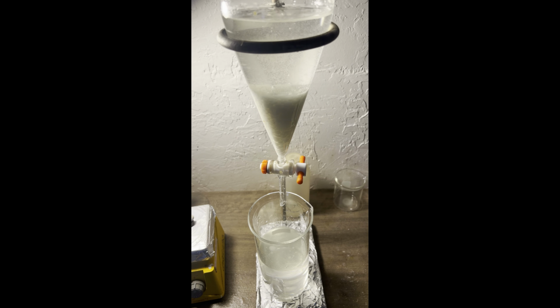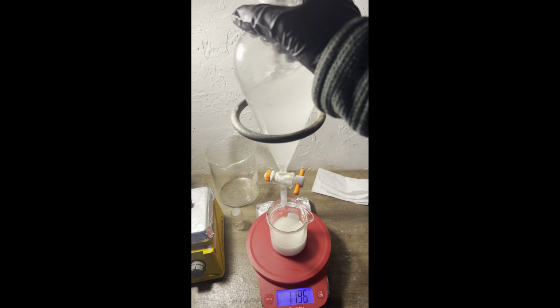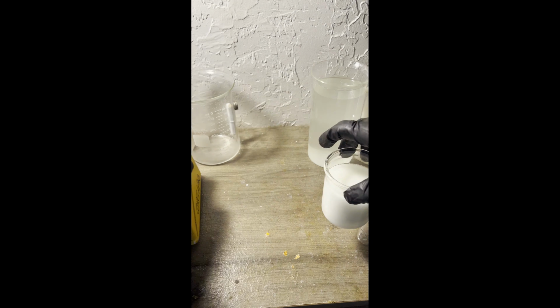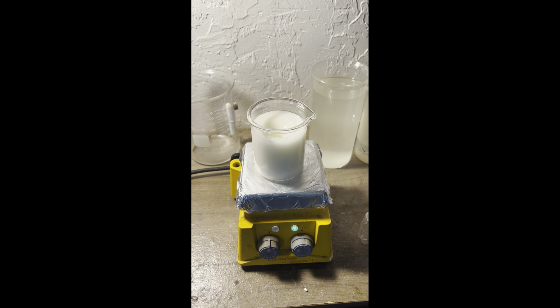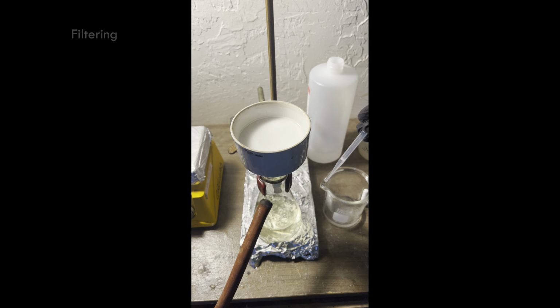an hour. The first sign that something went wrong was when barely any heat was evolved while adding the mixed acid. It barely took 10 minutes while maintaining the temperature between 5 and 15 degrees. After the acid was added and the mixture was stirred for an additional 15 minutes, it was poured into approximately 700 grams of ice. This was the second sign that something went wrong. Why was there so much ice required when so little melted upon adding the reaction mixture?